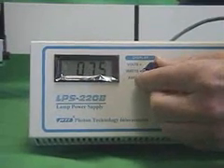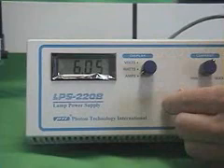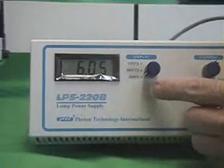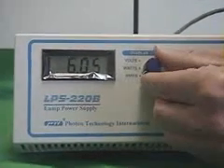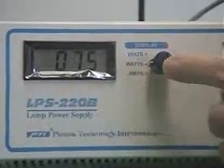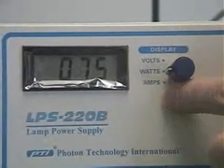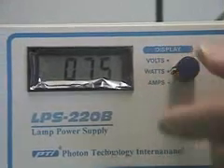You can also look at the amps display. A new lamp will have a current of about 6 to 6.3 amps. To keep the watts at 75 watts, as the volts increase, the current, the amps, will decrease.